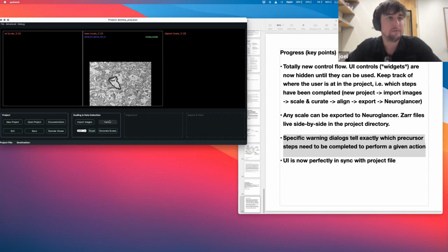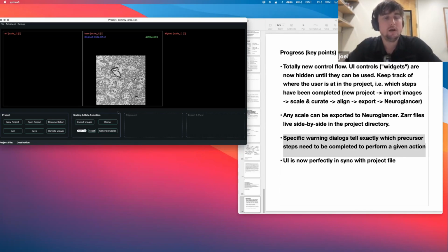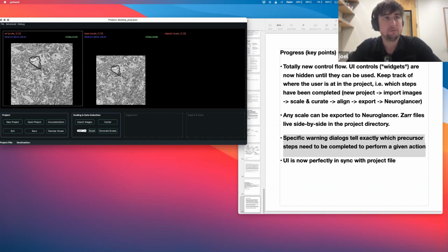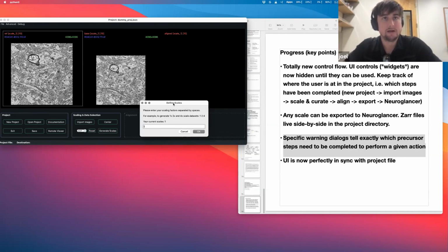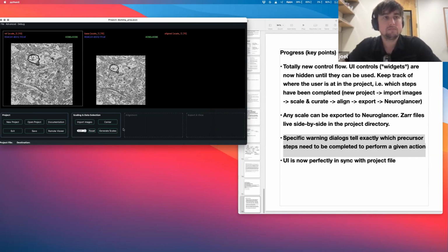Okay, so center, and then you can go through the images, the reference image on the left, and then the current image in the middle, and then we'll get the aligned image stack right here. Then we click generate scales, we get a dialog. We'll just do just 2 scales. And now it's generating the scales. And now that the scales have been generated, it's a small data set, so it did it quickly.